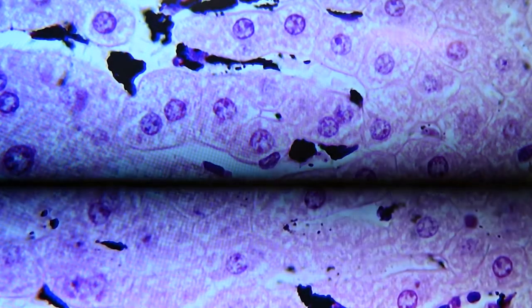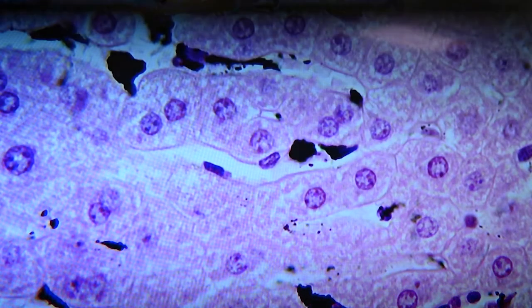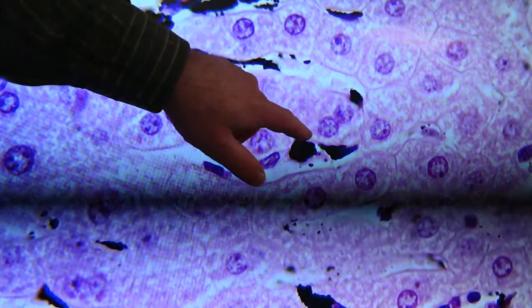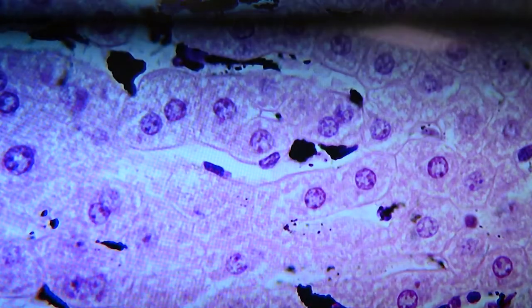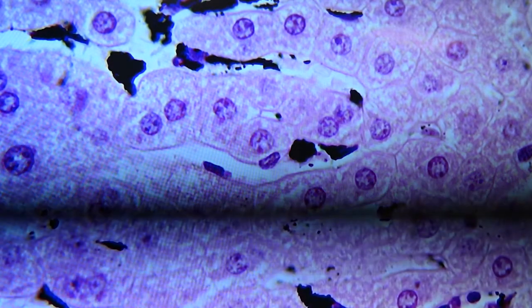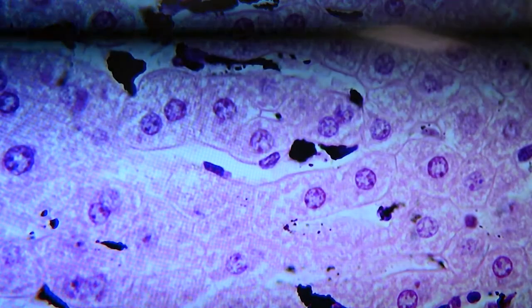They acquired enough of it so that they retain it and have this very dark color in this slide. So all these dark patches you see in here are bits of Kupffer cells that have retained that carbon that's been put into the tissue. So that makes it hard to see the individual Kupffer cells for all that stuff that's in it.